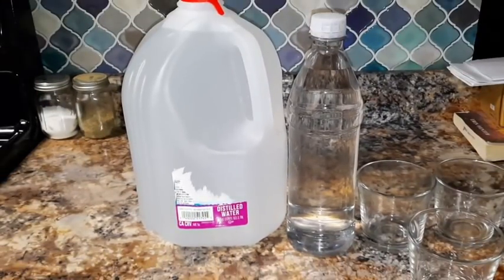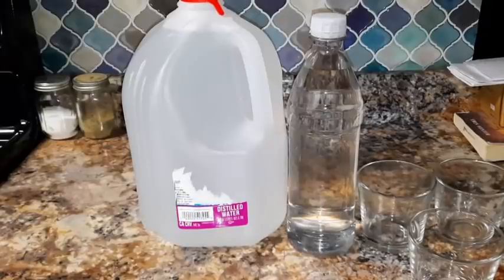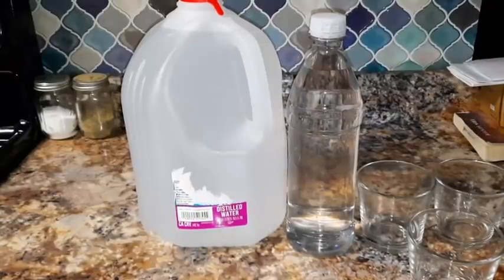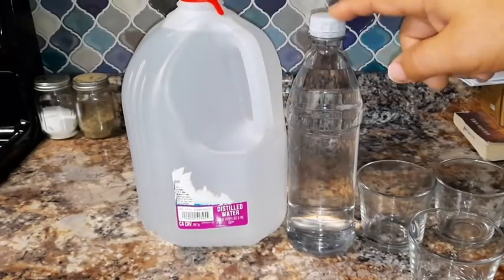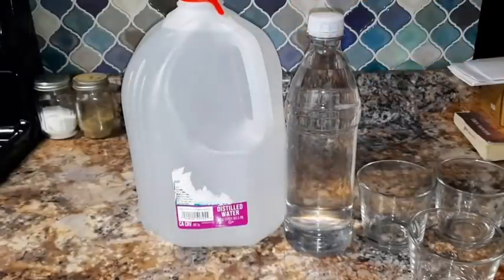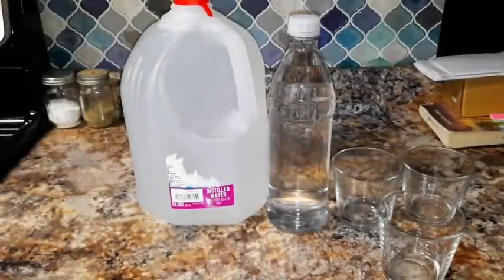Welcome ladies and gentlemen. Today I'm going to show you what the difference is in the ppms, or the particulates, in the water that you drink on a regular basis, be it distilled water, regular store-bought water in a bottle, your tap water, and/or your reverse osmosis water if you have a reverse osmosis system. Today I am only going to show you what the difference is in particulates.